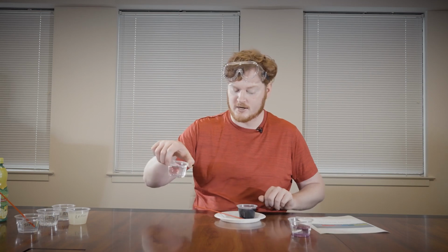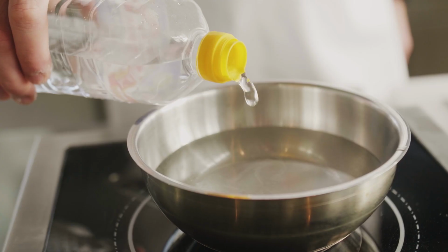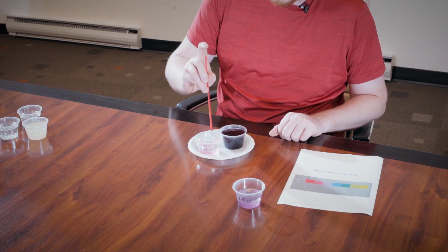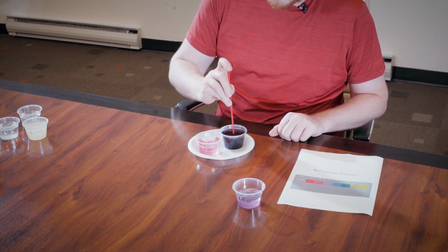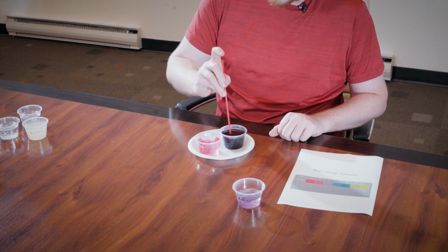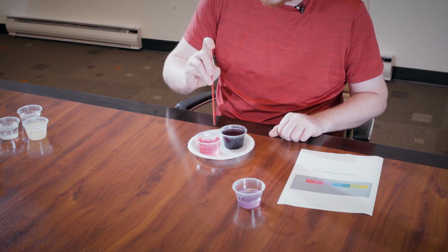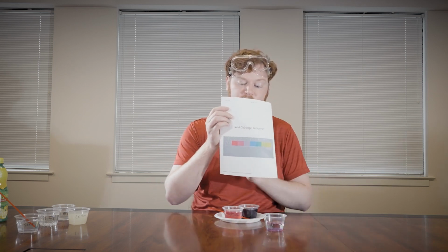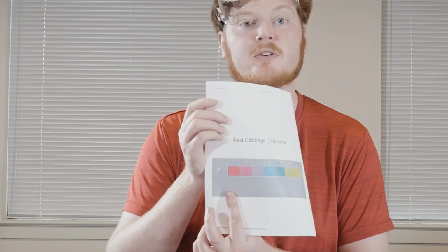Next, let's try vinegar. Vinegar has certainly a strong odor to it. I'm going to place some of this substance in here, my indicator, and already you can see, and you notice I'm not putting my pipette into the solution. We don't want to cross-contaminate. But already you can see the comparison, how the vinegar has this bright pink color to it, because the indicator is going to change color to show that vinegar is very acidic.